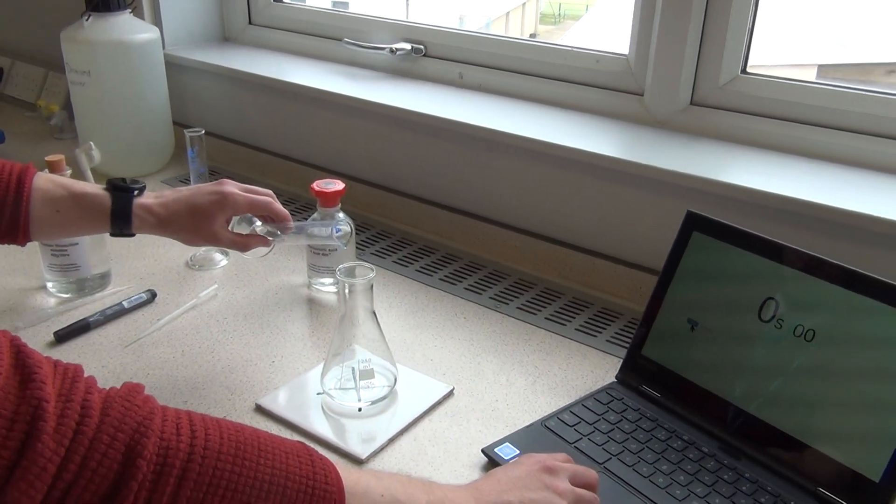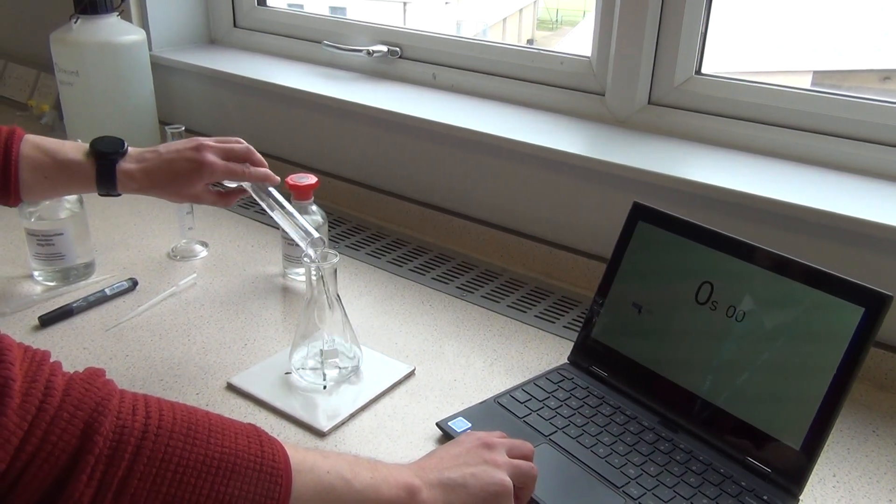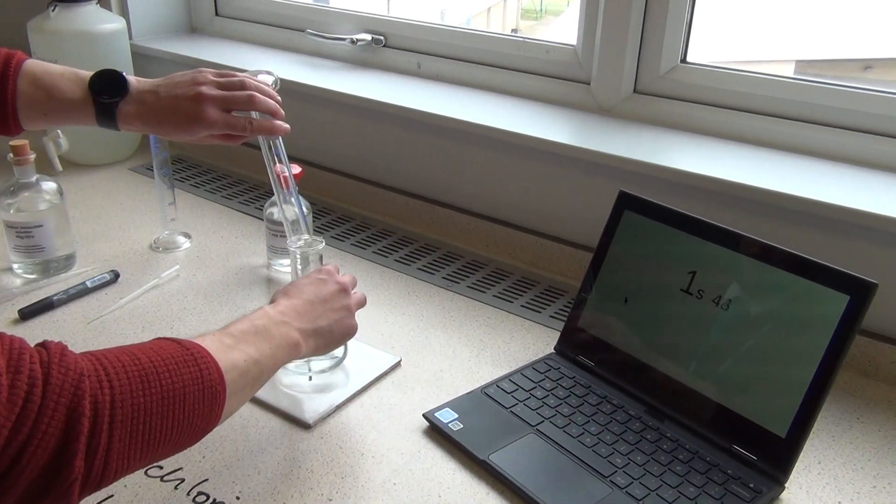Okay, here we go, can we get the timer in shot as well? Let's add the hydrochloric acid and start my timer, give it a quick swirl, done.